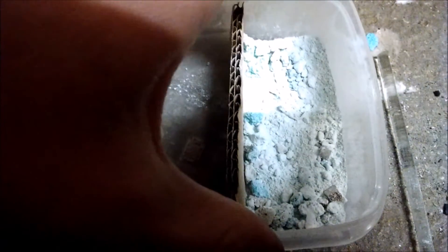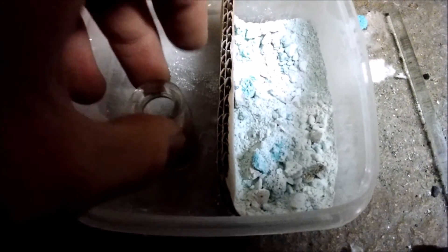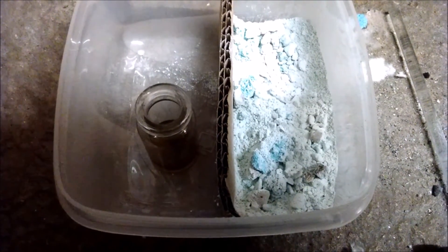Okay, so, what you want to do as a final step: transfer your anhydrous sulfate into one side of the container. It's all there, I've got a fair amount. Then get whatever you want to dry, put it in the other side, get the lid of the Tupperware container, and just put it down, making an airtight seal.